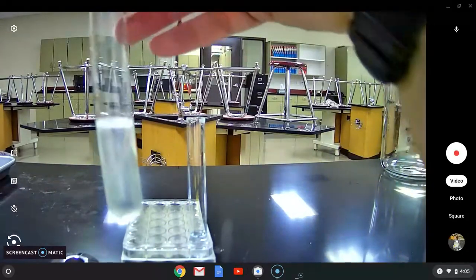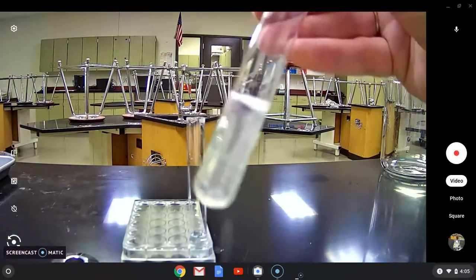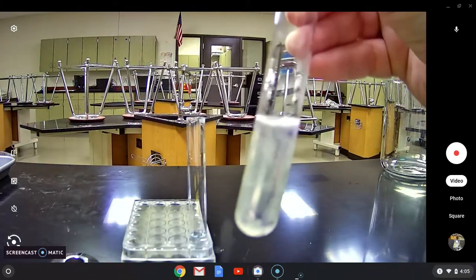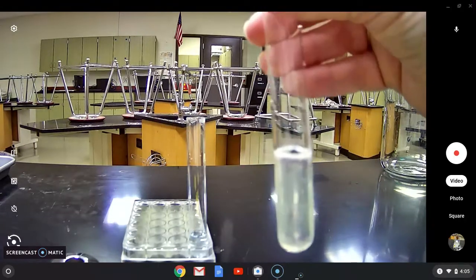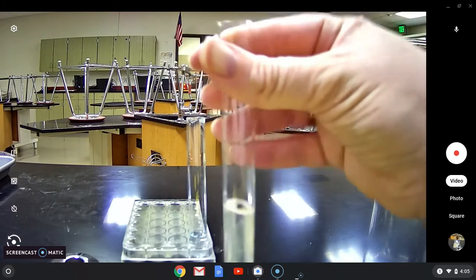In the protein solution you can kind of see I'm trying to make it so that you can see what it did. If you can see on top of it there's a color change.